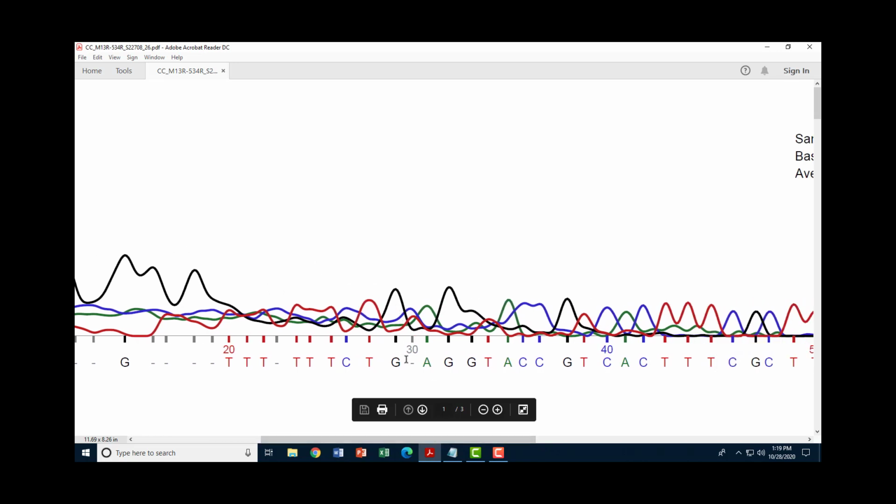Here at position 30, the machine is uncertain what it should call the nucleotide at this position. And that's because it has 2 peaks at that position. It doesn't really know what to do. It doesn't know if it should call it thymine or if it should call it cytosine. Now in this case, this is where you kind of make a judgment call. We do have a peak and a peak. They're pretty clear. But the intensity at this position is greater for cytosine. So I might go ahead and plug in cytosine at that position.